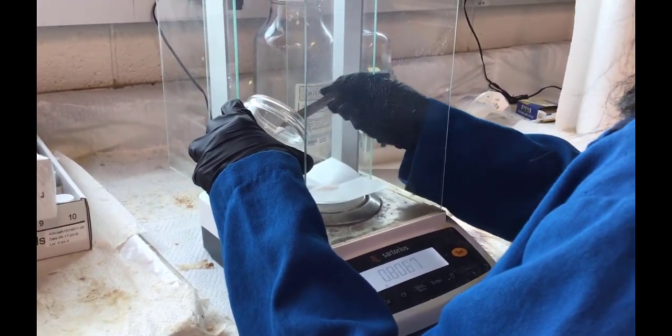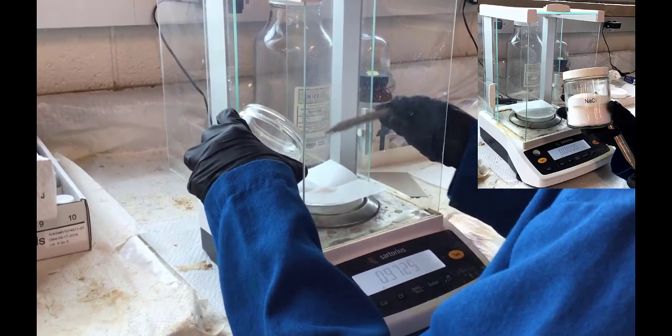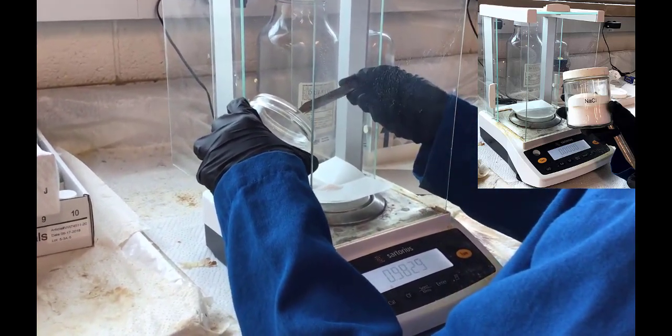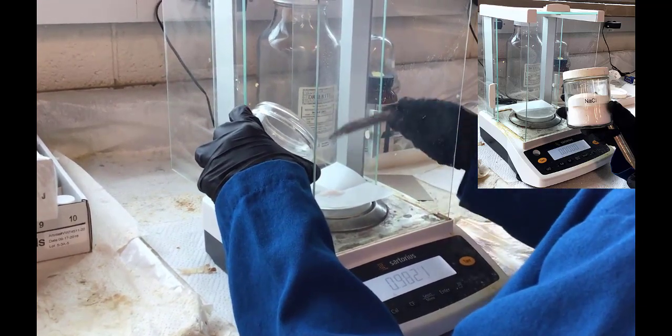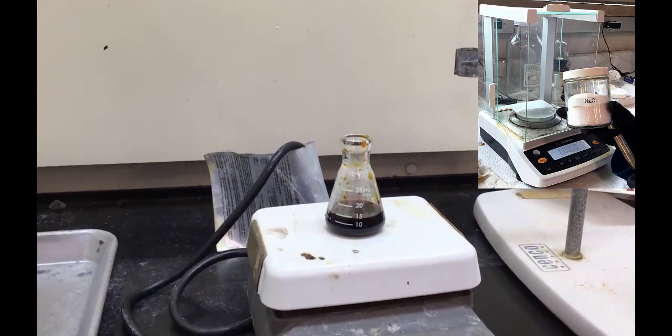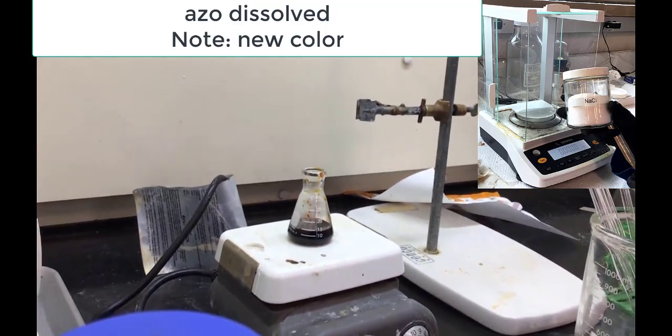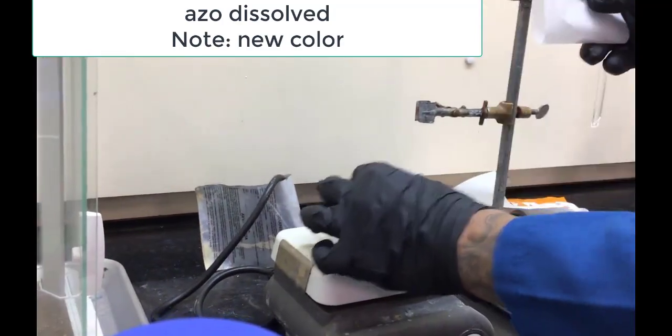So while they're waiting on that to happen, they're weighing out sodium chloride. They're going to get 1 gram of sodium chloride. You can see they're already at about 0.98 grams. All right, so stopping there at about 1.02. Now, all of the azo compound dissolved, so do pay attention. There has been a drastic color change.